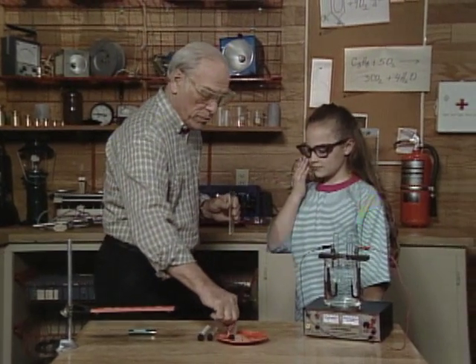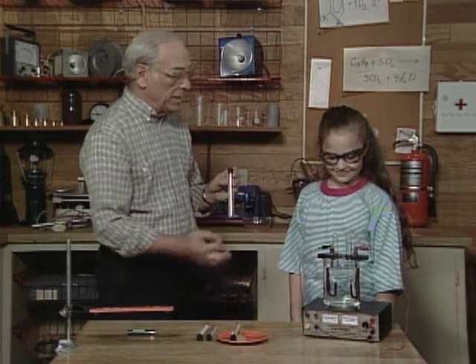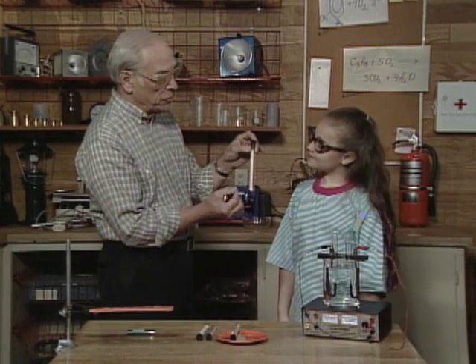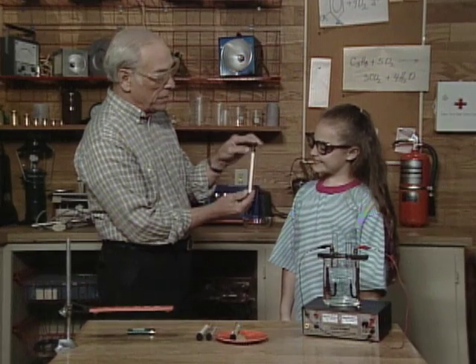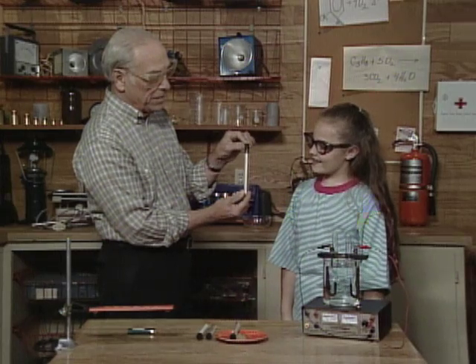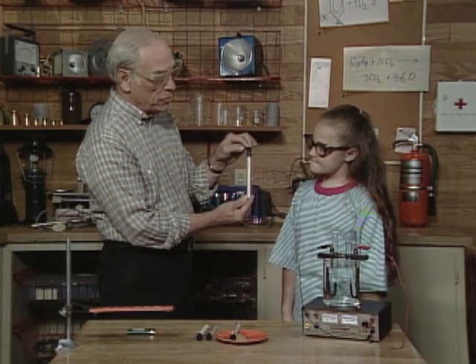Christina, you probably have never done this before, but now we've taken water apart to get hydrogen and oxygen. And in this case we combined the hydrogen with the oxygen in the air and we made some water again — by combining hydrogen and oxygen in the formula H₂O.